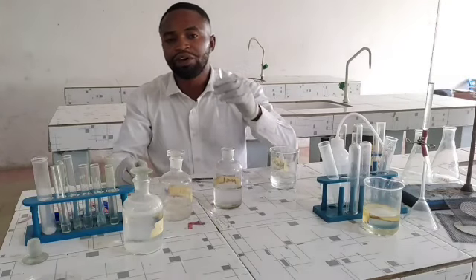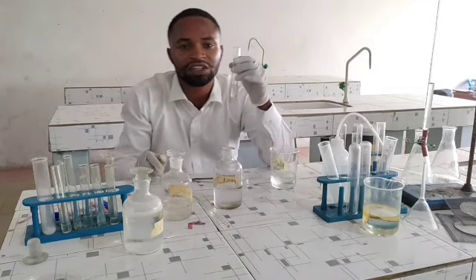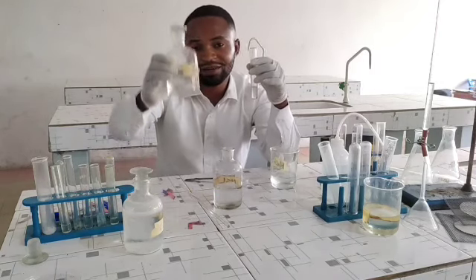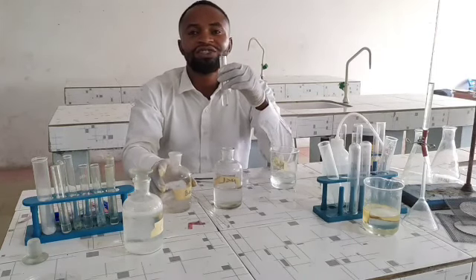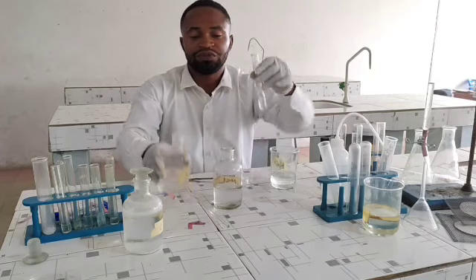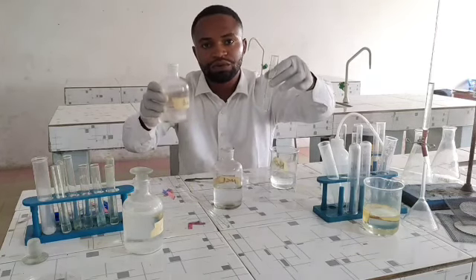Thereafter, I add barium chloride to it. So what is the test there? C plus 5 mils of distilled water plus barium chloride. I got my barium chloride here with me. So I'm going to add barium chloride to it. Please take note of the observation. What will be the observation? A white powdery precipitate is going to form.